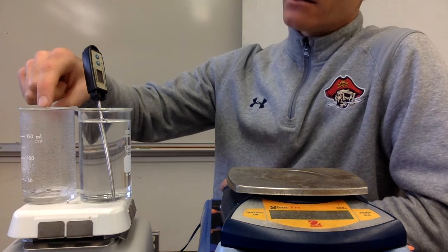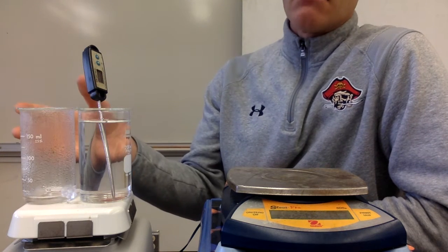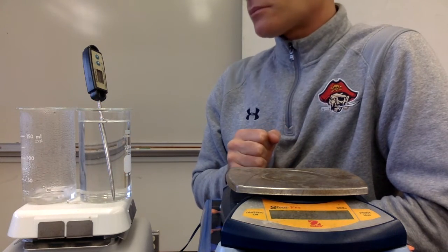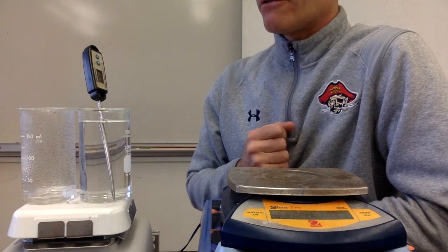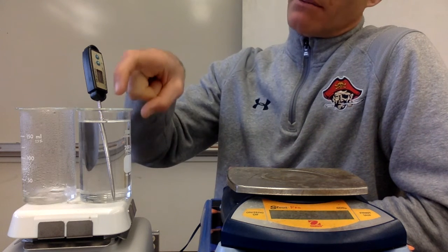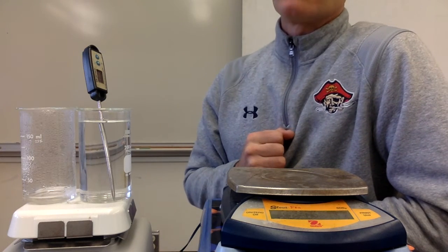We know the mass of this hot water that we started with, and so we're going to turn that to moles because we want our heat of vaporization to be per mole. So once that's all gone, we'll be able to figure out how many moles of water evaporated, and by figuring out how much heat this absorbed, we'll know how much heat was required to turn that to a vapor as well.